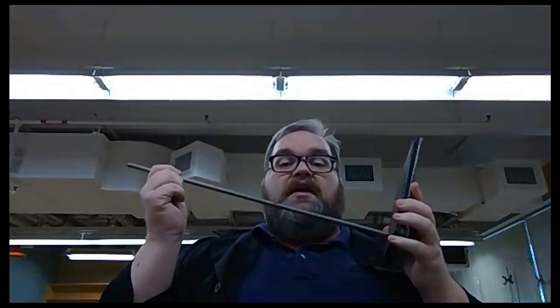To complete today's experiment, we're going to need a lot of equipment to make sure that we can do this safely. First thing we're going to need is an iron ring stand. To go with that, you're definitely going to need an iron ring. You're also going to need a piece of wire gauze.